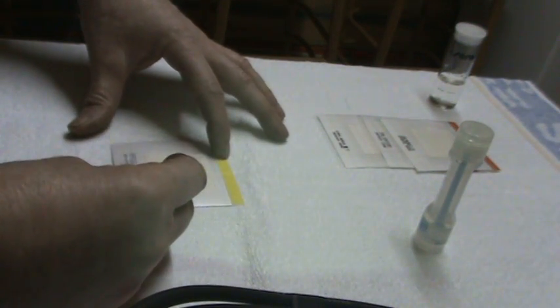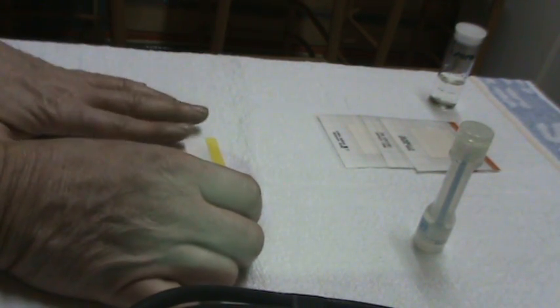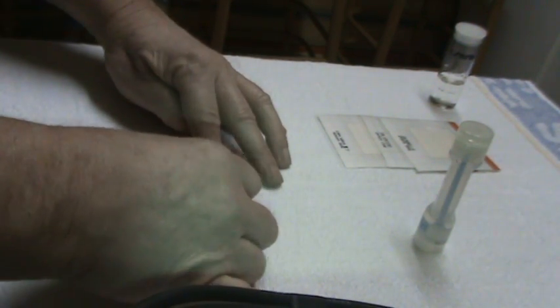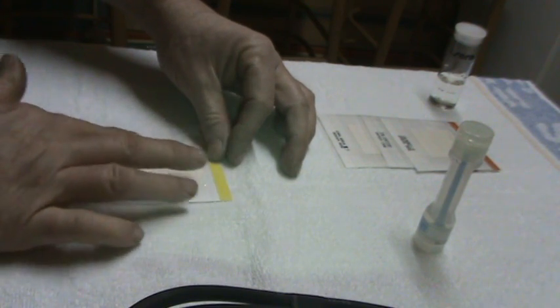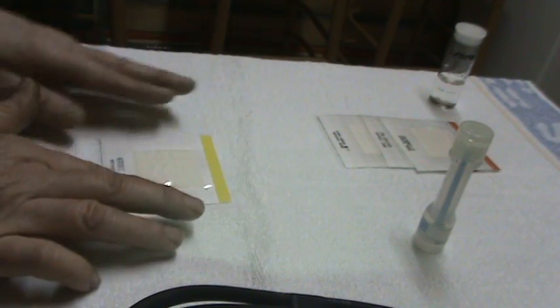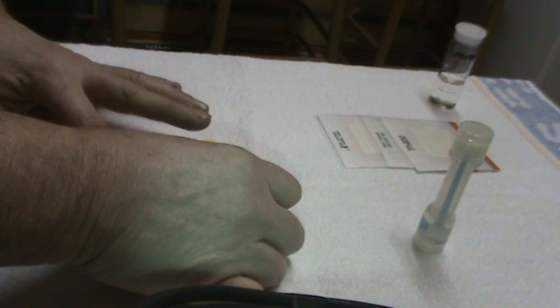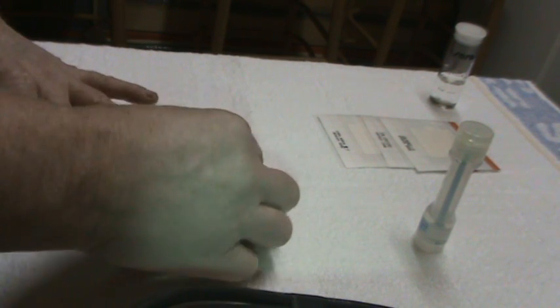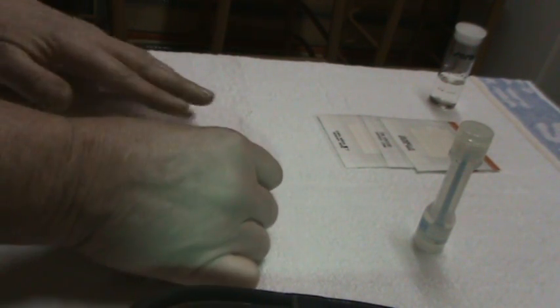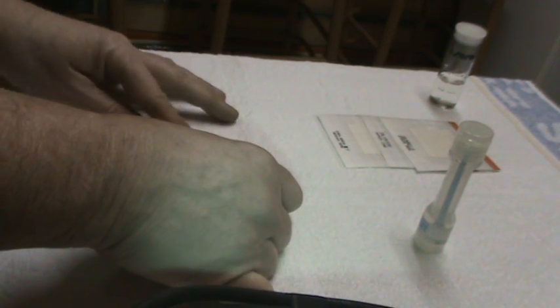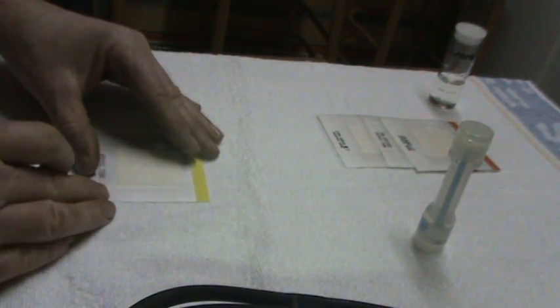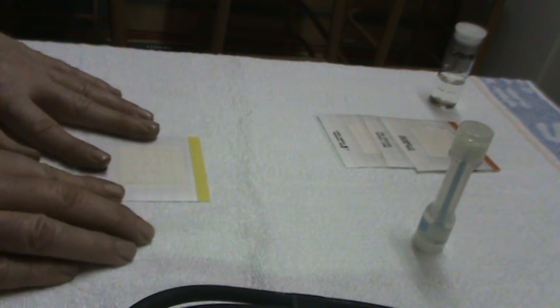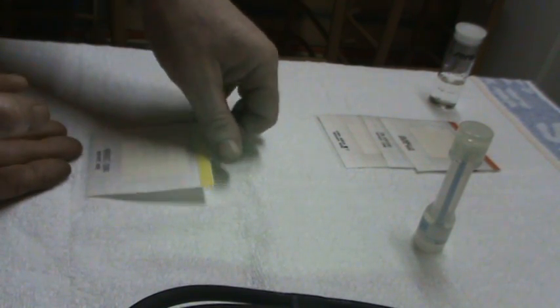Then you carefully close the slide. Lay down the foil covering it and make sure no air is contained. It is a little hard on this ground here. This one is ready for use, so I am just going to put it away for a while.